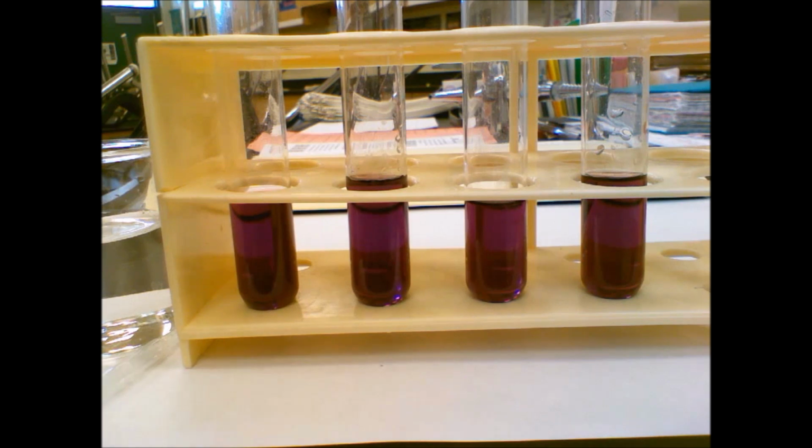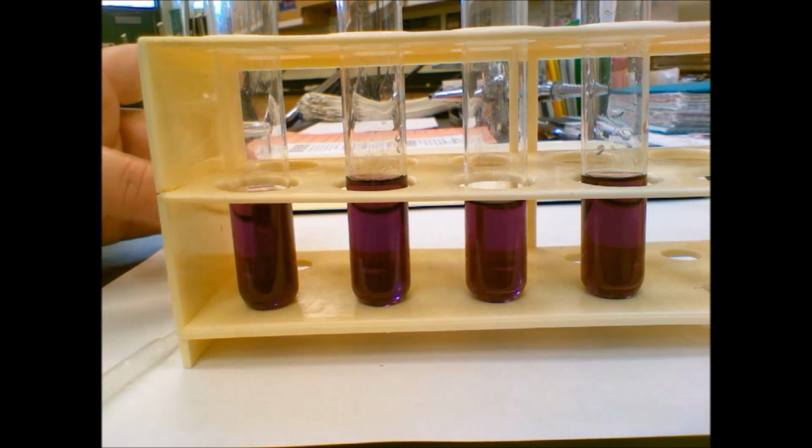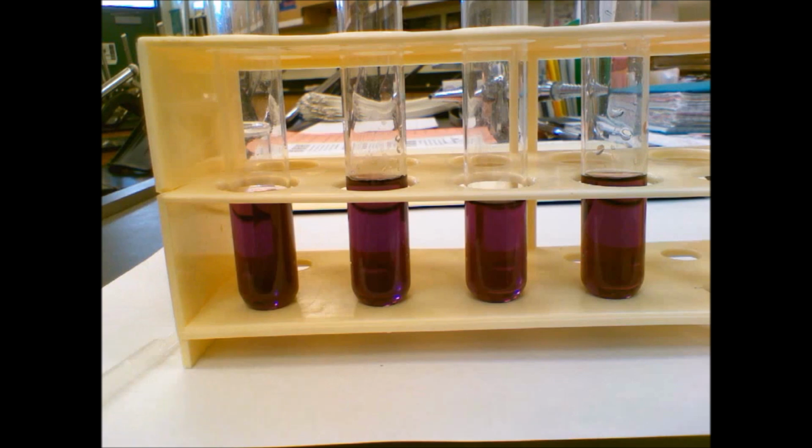it's relieving these stresses. So if you look at your reaction, it says X, the chemical X is represented by pink color. If we add hydrochloric acid and heat to it, those are our reactants. So X, HCl, and heat. On the product side, it makes Y, which is our blue tinted chemical, and water. So we are going to be adding some stressors to this reaction and seeing what occurs due to those stressors.